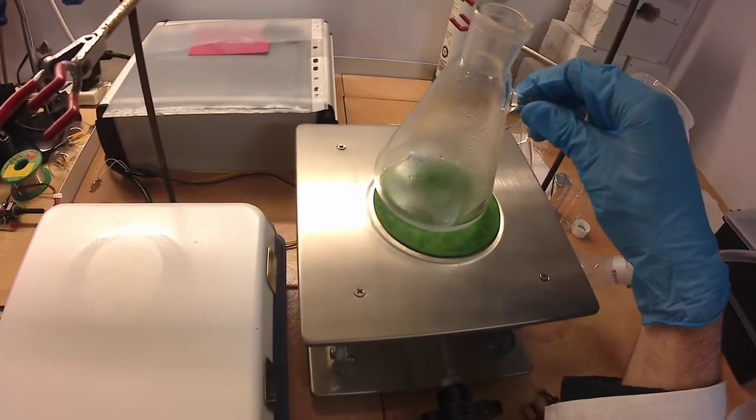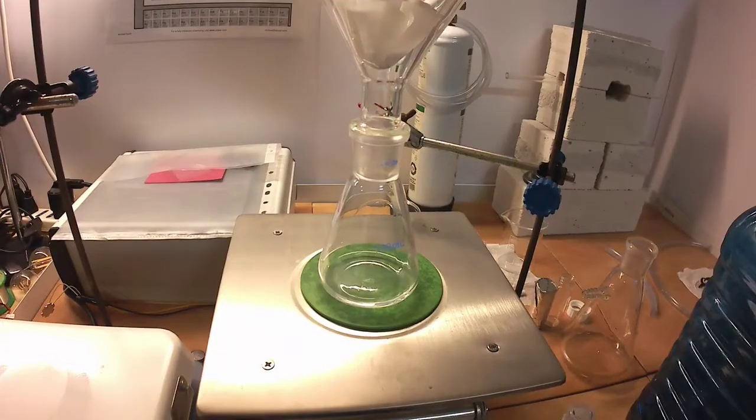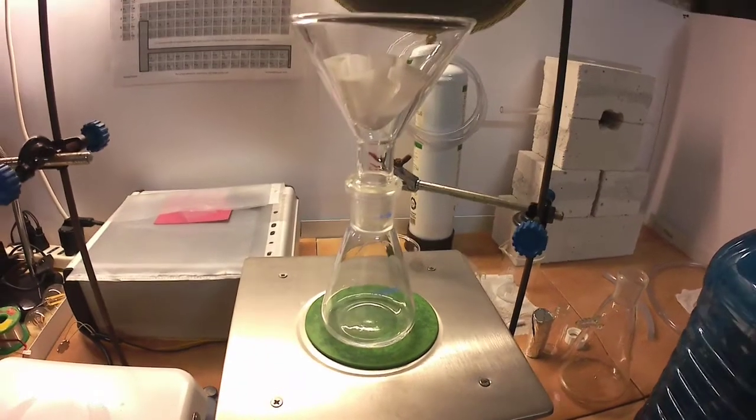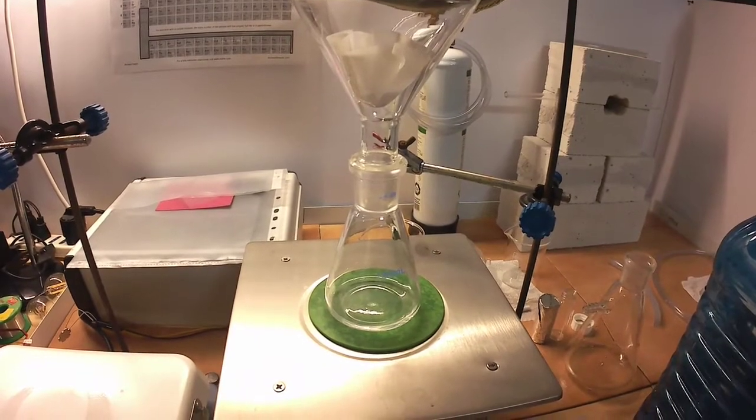At the end of the reaction, there was still some unreacted solid, which could be silver oxide that was not reduced by the ascorbic acid, so it's time for another filtration.